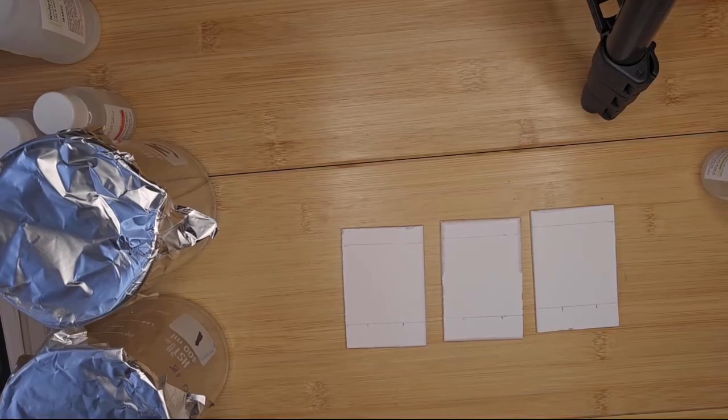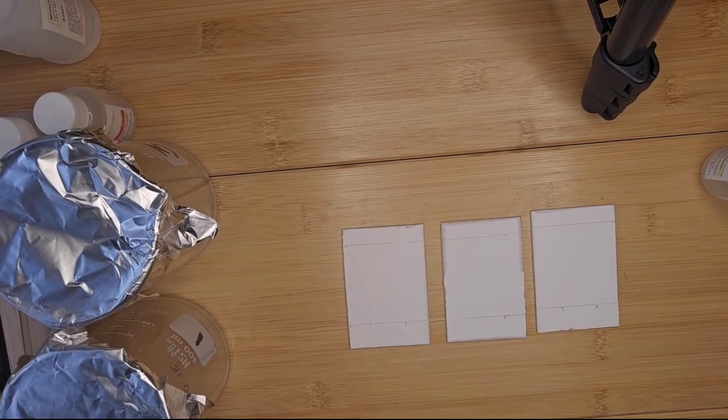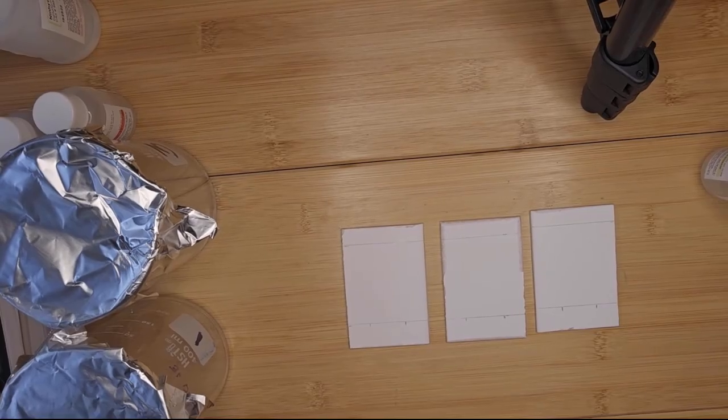So I'm going to apply now my samples and controls, using these capillary sticks. I have tubes of capillary for each. What I'm going to do is apply the alanine standard, and you don't want to apply large amounts of sample.